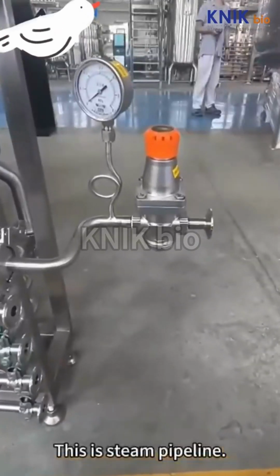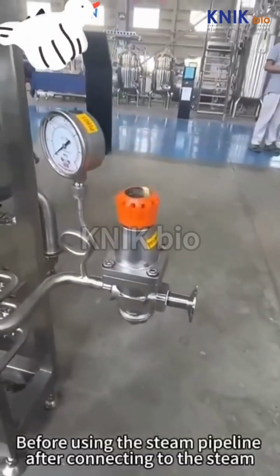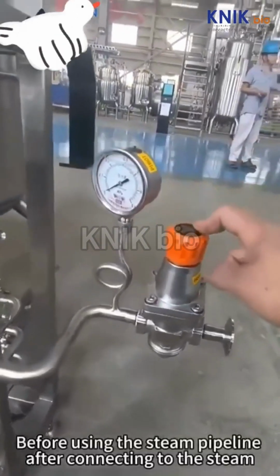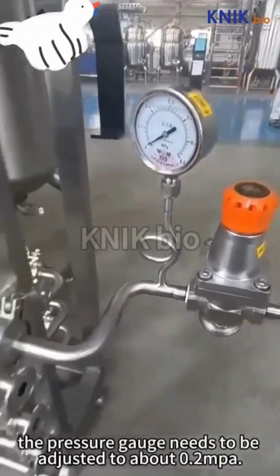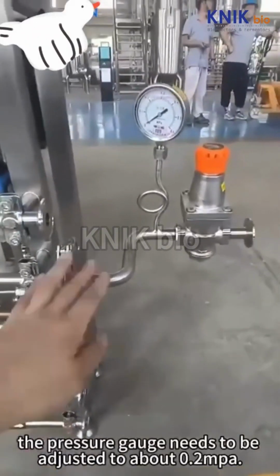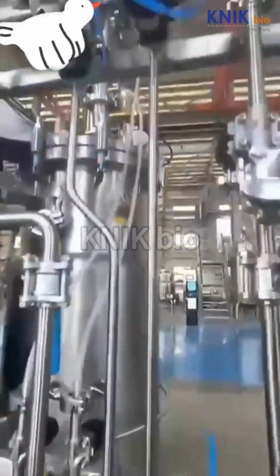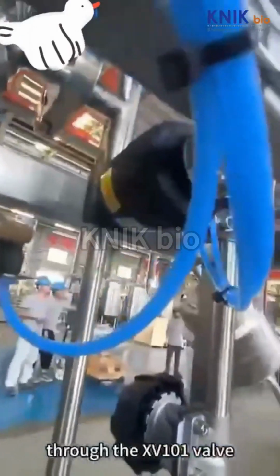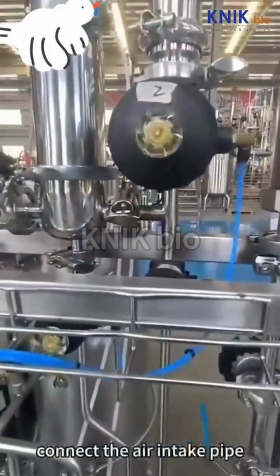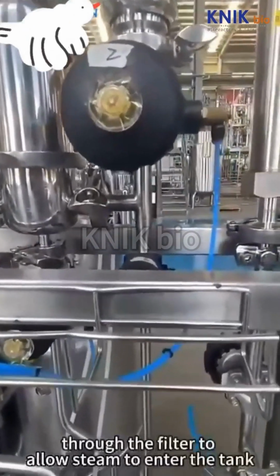This is the steam pipeline. Before using the steam pipeline, after connecting to the steam, the pressure gauge needs to be adjusted to about 0.2 MPa. Through the XV101 valve, connect the air intake pipe. Through the filter to allow steam to enter the tank.